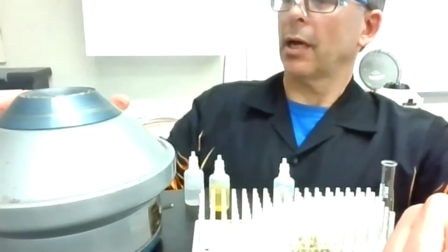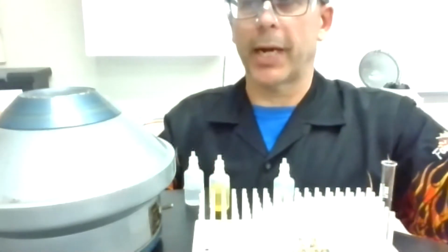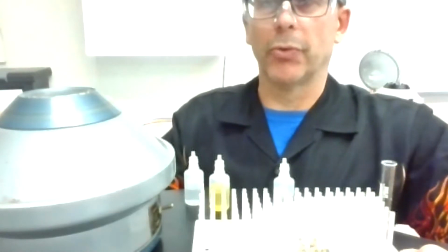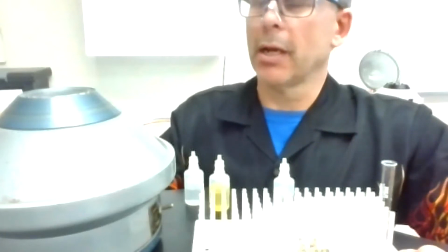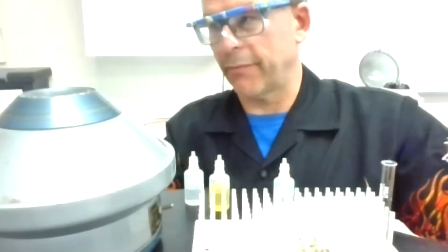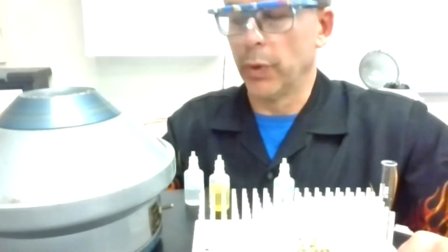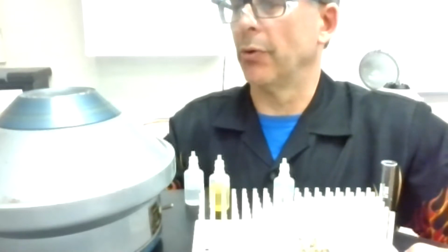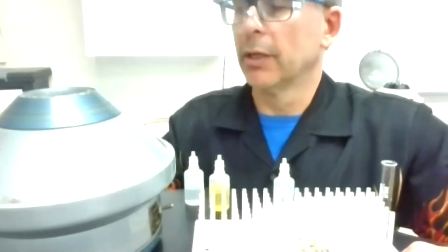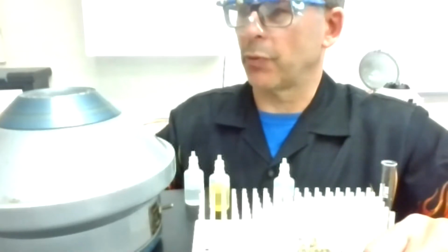Let's talk a little bit about the centrifuge. I put it in here. Notice I had a blank test tube. I want to keep a balanced load when I do this, and it's going to spin around really fast, and heavier things go to the outside, which would be like the precipitate. So if you were at Valley Fair, you went on a ride, you weigh more than air, you're going to feel like you're being forced to the outside with the centrifugal force as you go around really, really fast. And that's what's happening. The precipitate's heavier than the solution part, so that should separate and go to the bottom, and it'll be kind of angled because of the way I put this in.